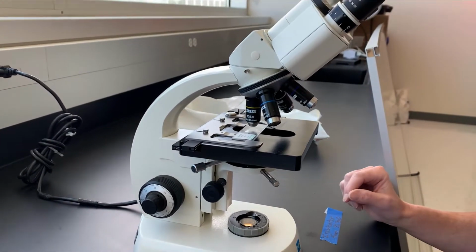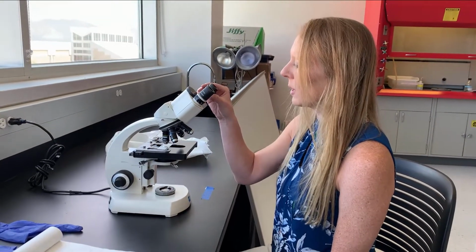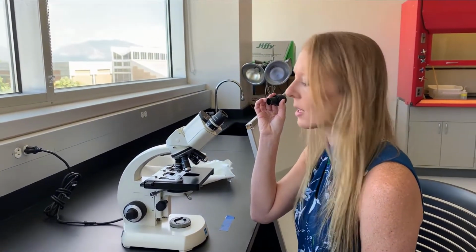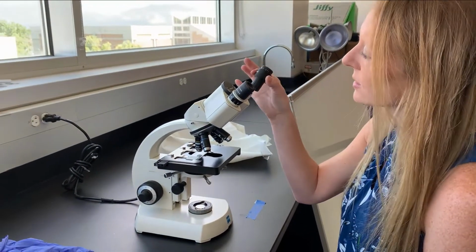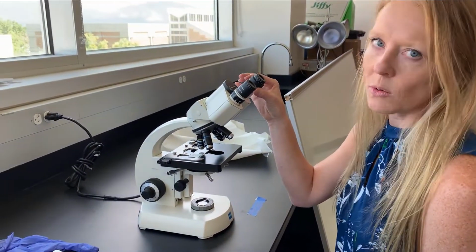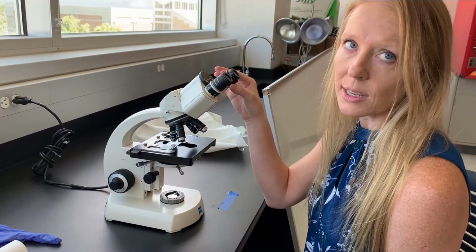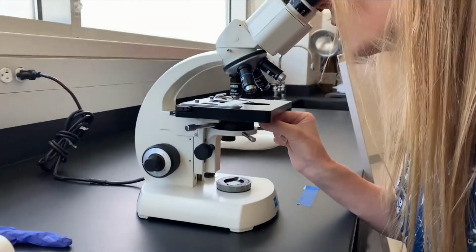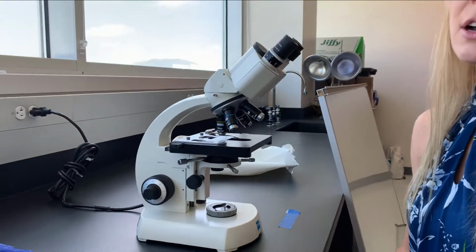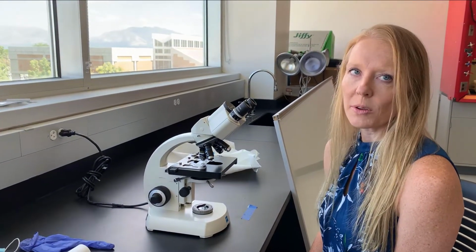Now that's kind of an easy hack to set the contrast. The actual way to do it would be to remove an eyepiece, and then you would look through and calculate sort of the area that is taking up. But as students, we don't want you to be removing eyepieces from the microscope at any time because it allows dust to get in there. So we're just going to use instead that quick and easy hack of closing down that condenser until our contrast is optimal. All right, and that's it. That's how easy it is to set up Kohler illumination.